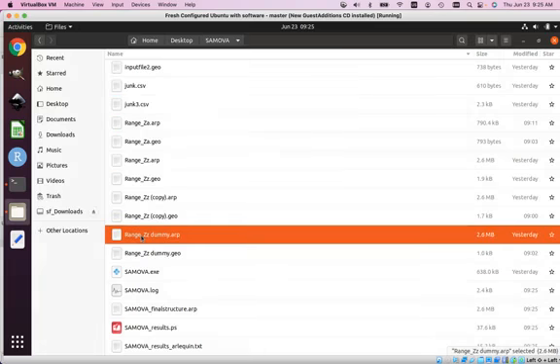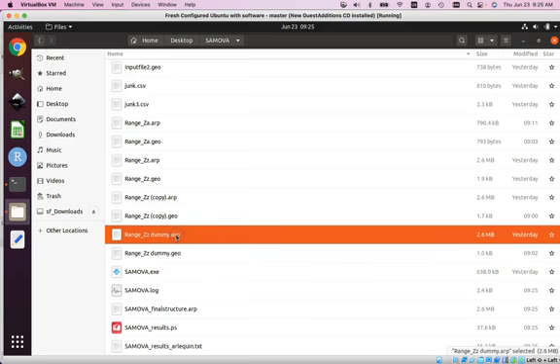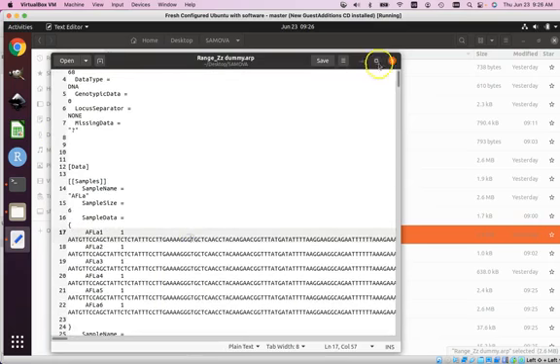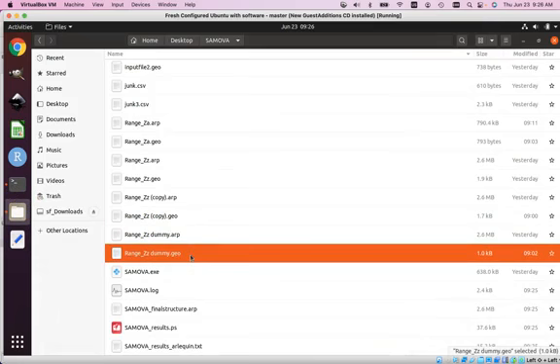If you look at the data I used for the geographic coordinates, and if you look at the specimen data that I used, it was the same specimen data that he had originally. It has all 68 specimens with all of their original names and all of their original DNA sequences. So the only thing I did to make it run was I changed the geometry of his specimens to that really contrived artificial geometry that I showed you before. So this tells us that it's not a problem with the number of specimens that he's using, and it's not a problem with the length of his DNA sequences or some problem with his DNA sequences. That it has to do with the geometry of his coordinates.